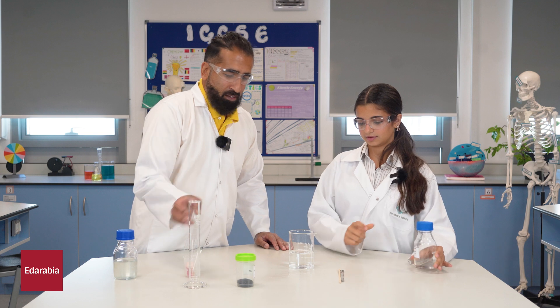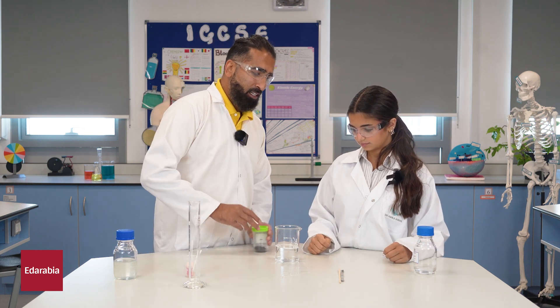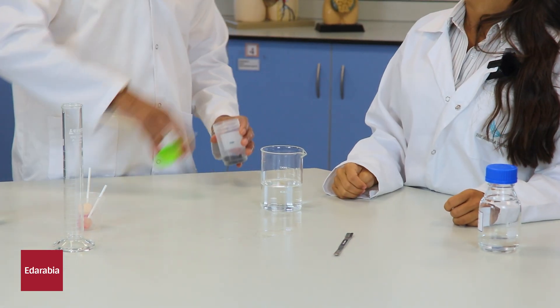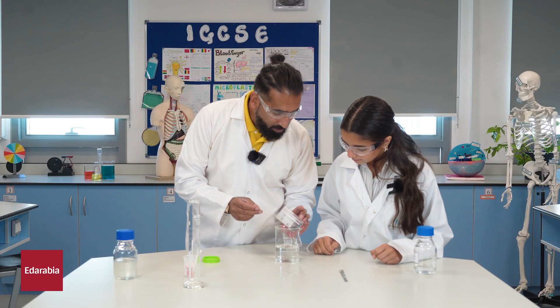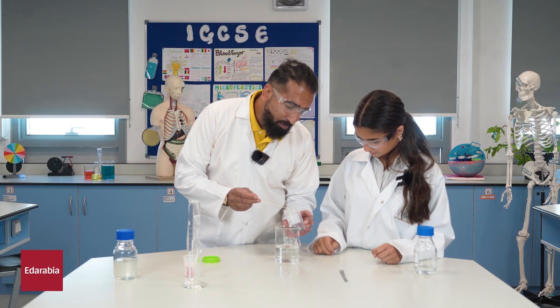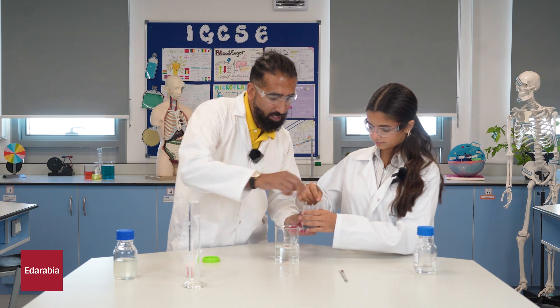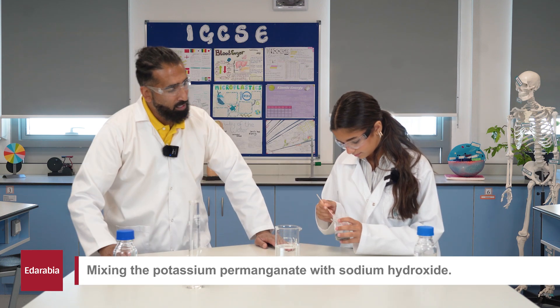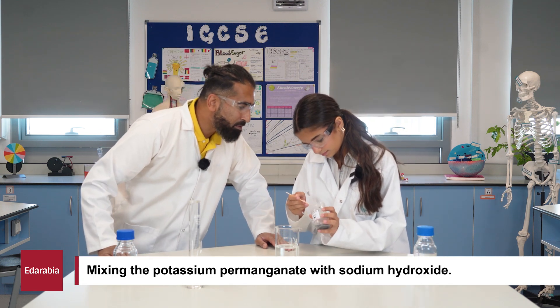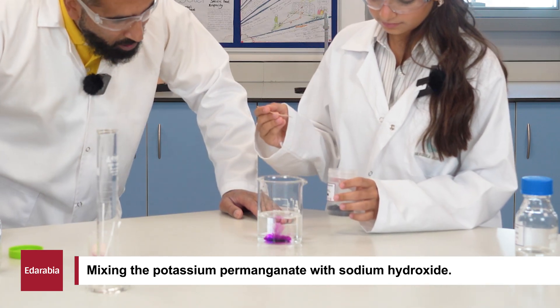So remember you said the potassium permanganate was what colour? Black. Black or grey or dark — yep. If you see what I'm doing here, I take a very small amount like that and you're going to drop it in there and give it a little stir. You should just be able to bounce it — yeah, perfect. Dip it in. Wow.